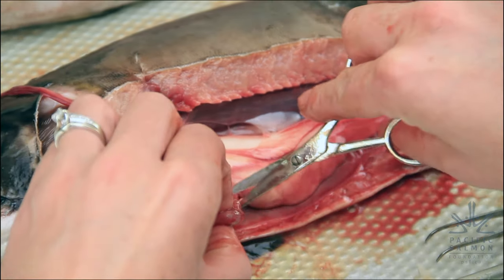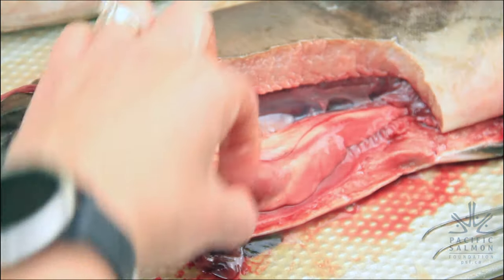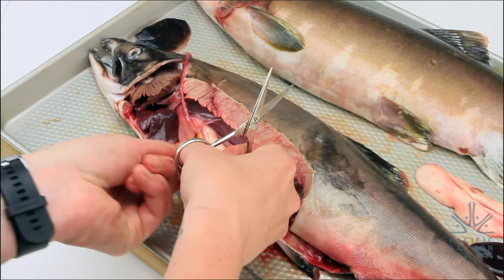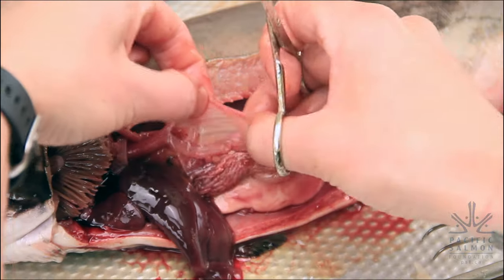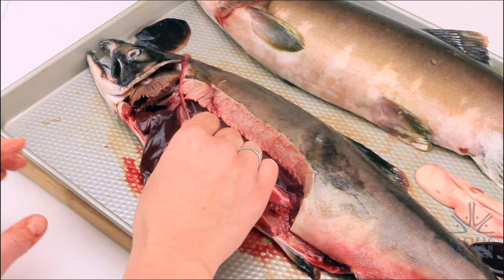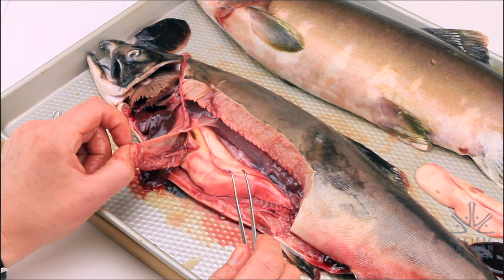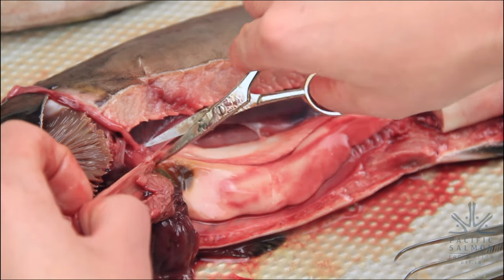You can see how small the stomach is, and by looking at it you can also see that the fish's stomach is very empty. The reason is that once fish start going back to the river to spawn, they really don't eat as much, putting most of their energy into spawning. If we had caught these fish out in the ocean when they were growing, their stomachs probably would have been more full. Typically, pink salmon like to eat small invertebrates, plankton, and bugs in the water.